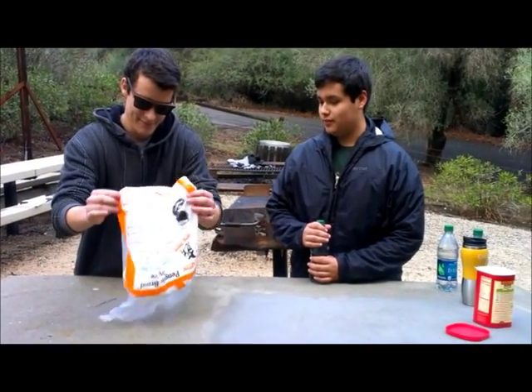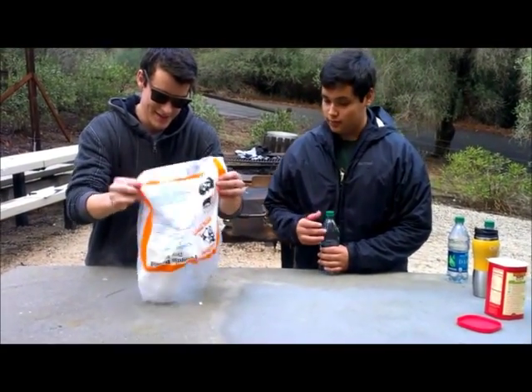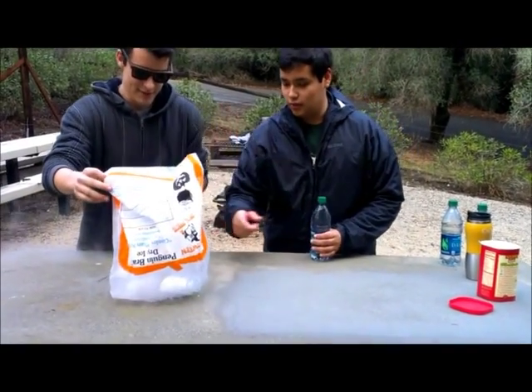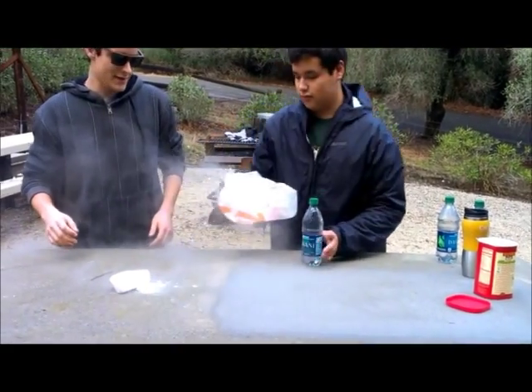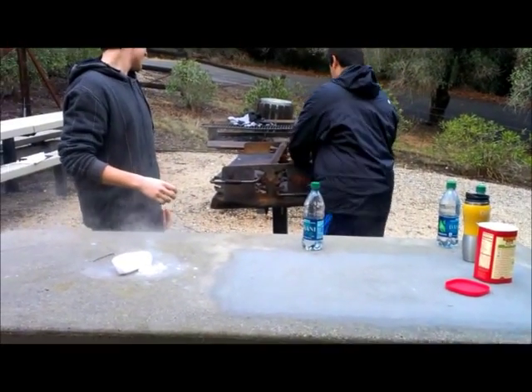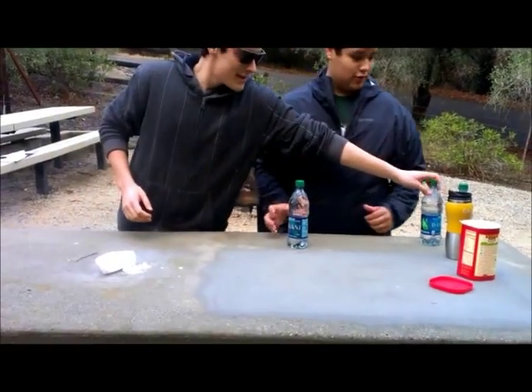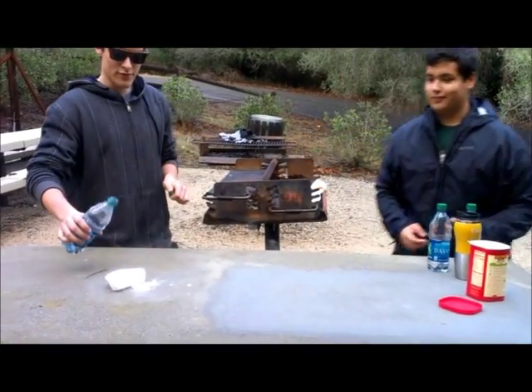You can bring this up. You don't want to pour more than one.